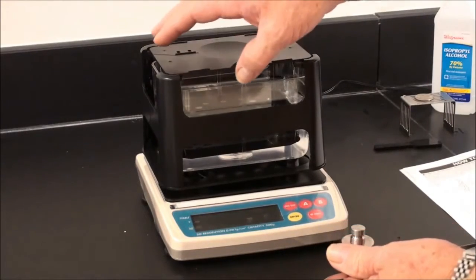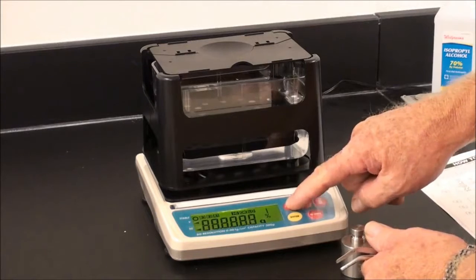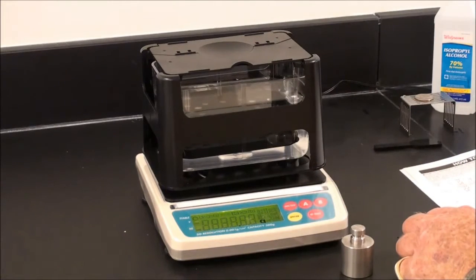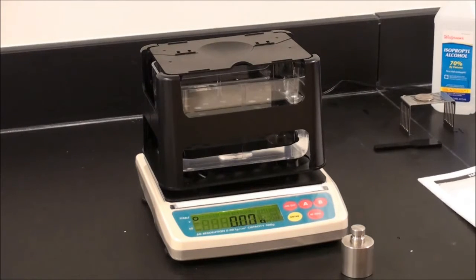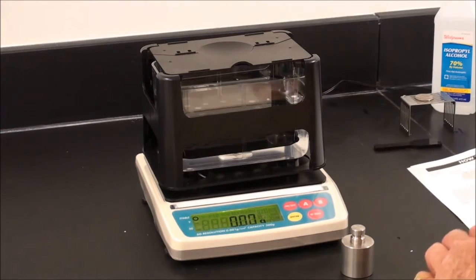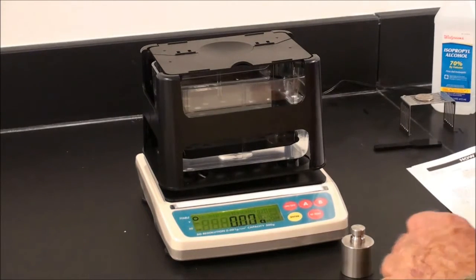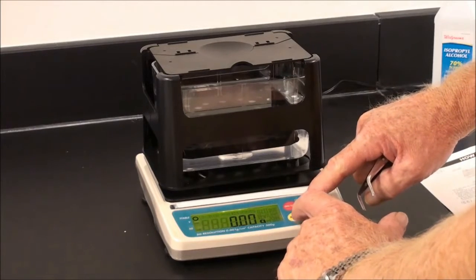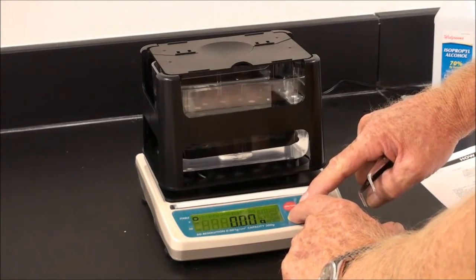Close the stage, turn the power on, allow the system to stabilize. To calibrate, hold down key A and press enter until CAL is displayed.